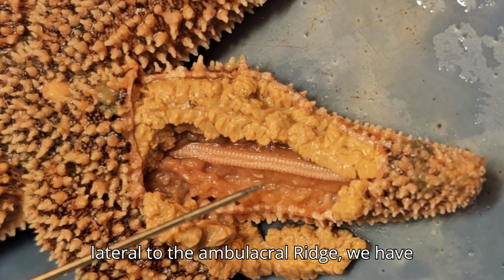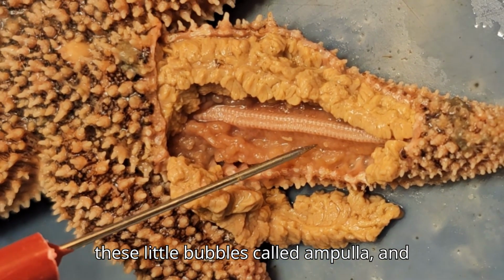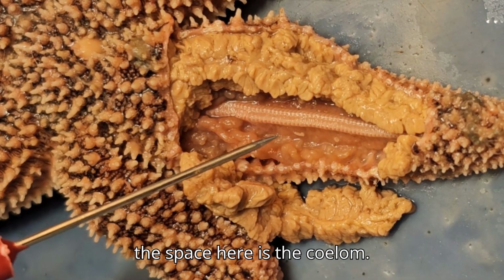And then lateral to the ambulacral ridge, we have these little bubbles called ampullae. And the space here is the coelom.